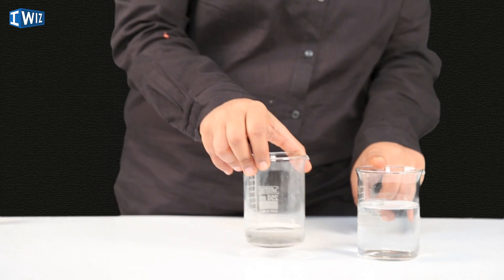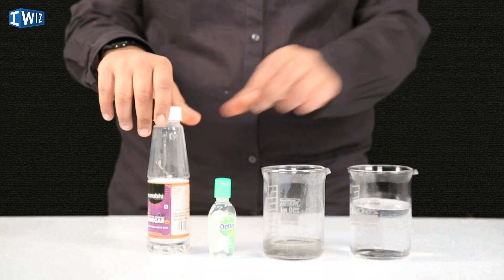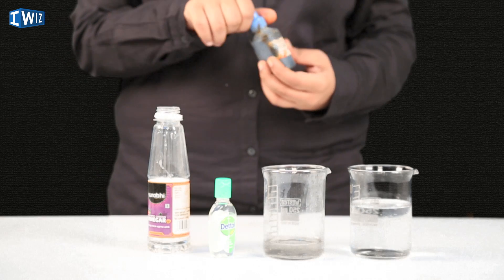We just saw the pH of four different sorts of water. Now let's get into why pH levels are important and how they affect life. Human beings — in fact all living organisms — operate within a very specific pH range, between 7 and 7.8. Most disinfectants that kill bacteria and germs operate outside this range, whether too acidic or too basic. I have chlorine water, bleach, a sanitizer, and vinegar here — all used as cleaning agents — so let's test their pH.